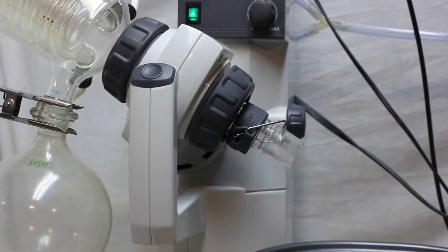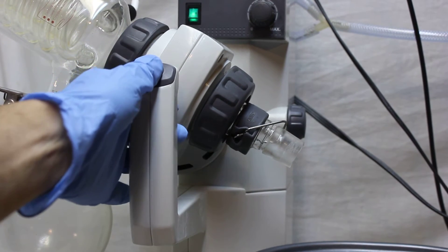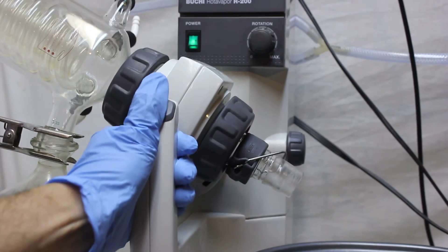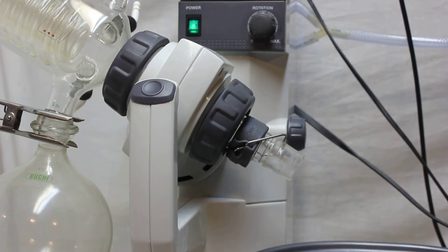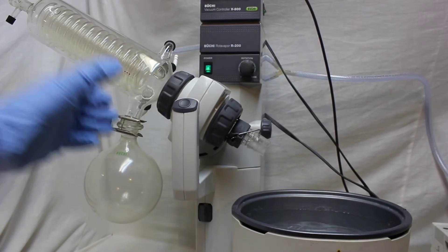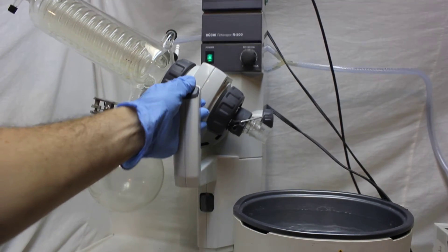Okay, so now you see moving down, moving up, moving down, up, down. It's working fine.